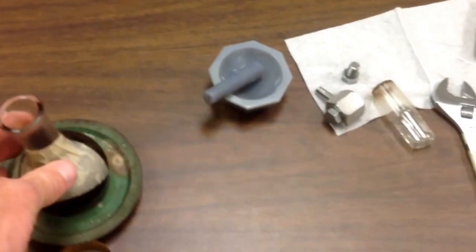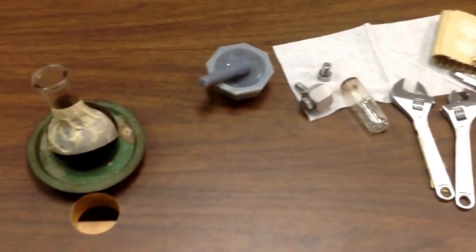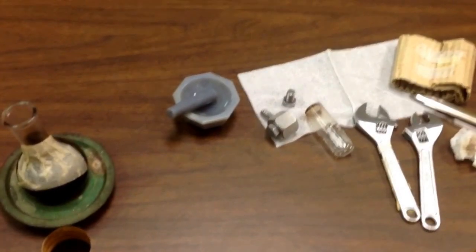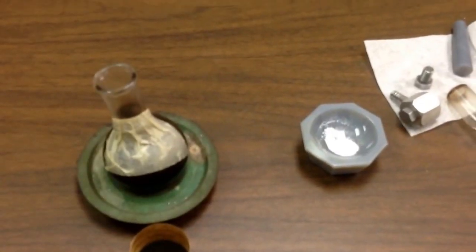I've chosen a sample that is of interest to me here. It's a colored sample, and it'll be nice because you'll be able to see just how little of that we're going to use in comparison to the potassium bromide that we're going to use. Now back to work.